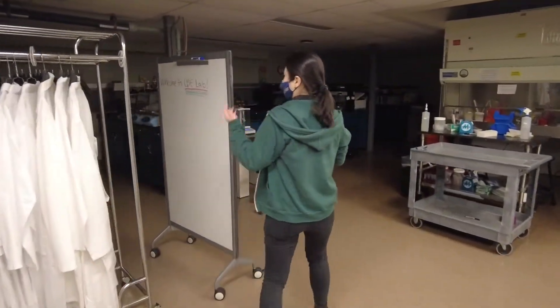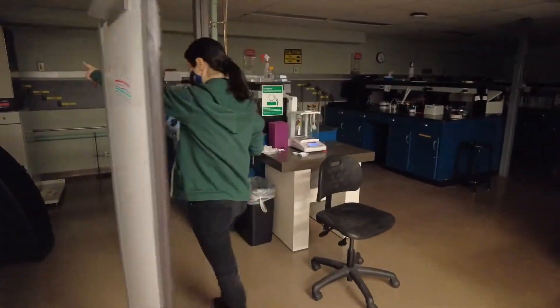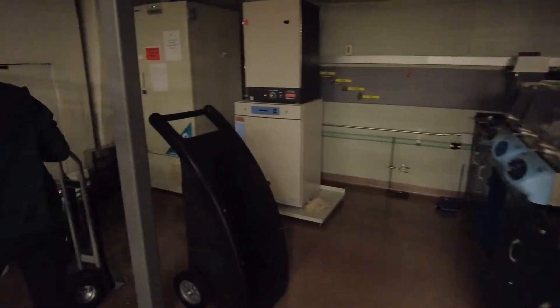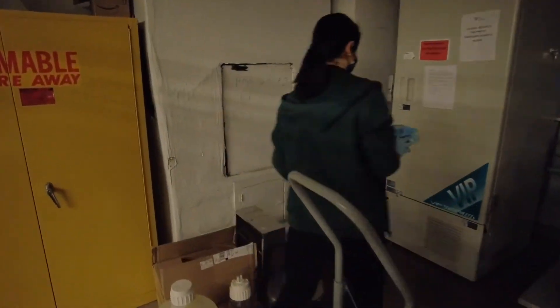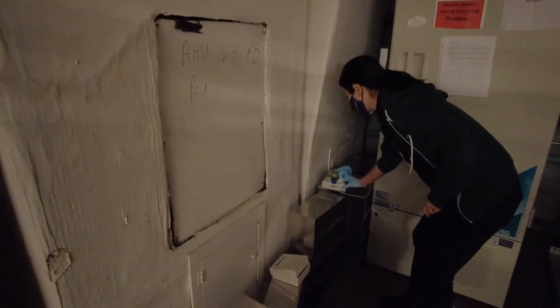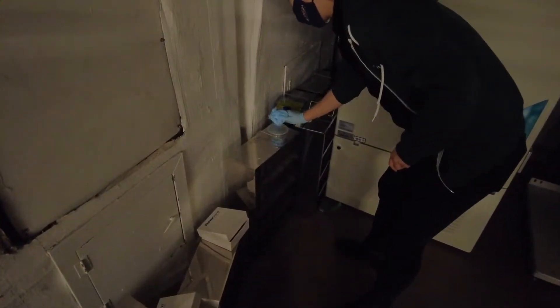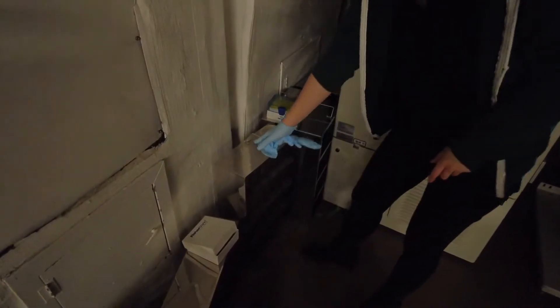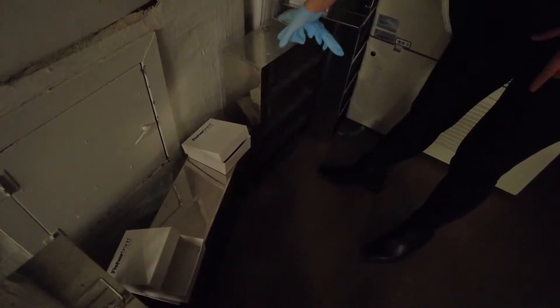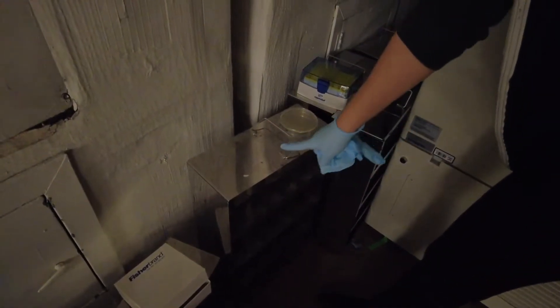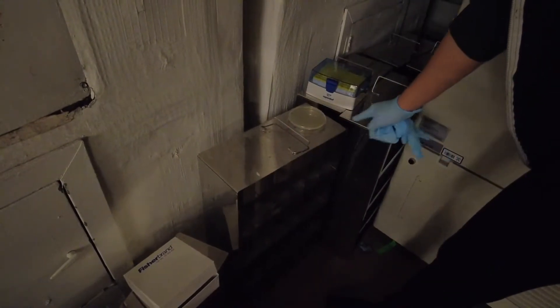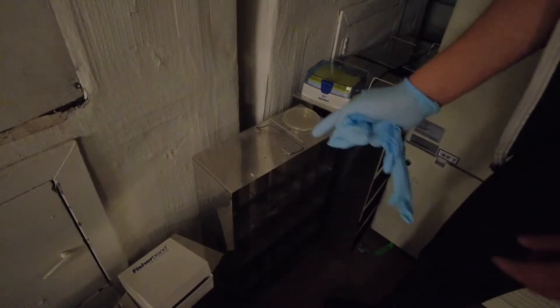You walk over to the freezer and set down your things. Make sure you have another space here to lay down the box you're taking out. This is where I'm setting off. Make sure it's steady so things don't fall down.